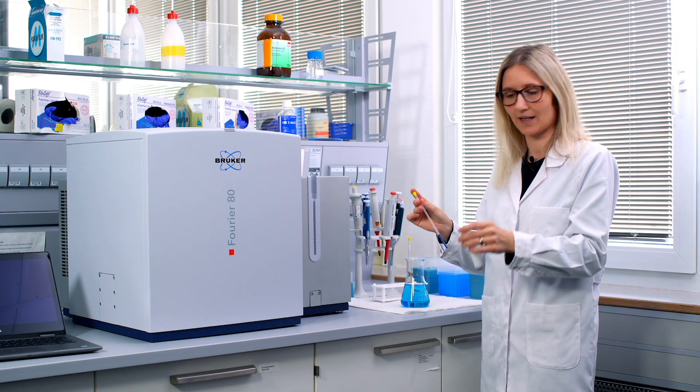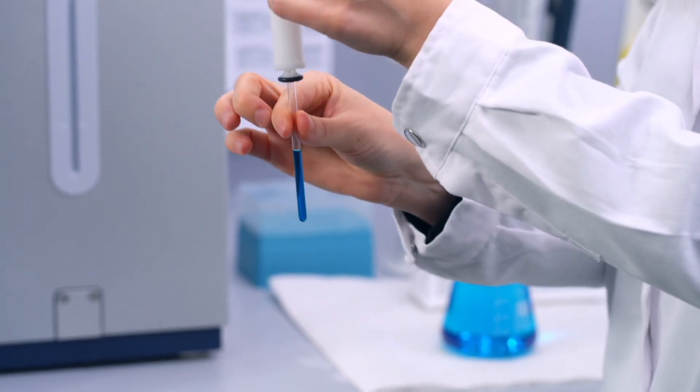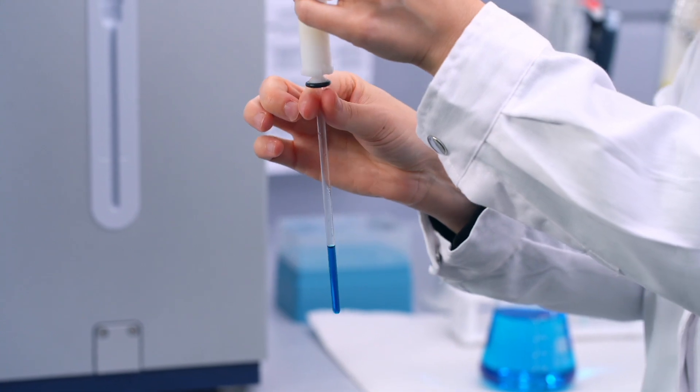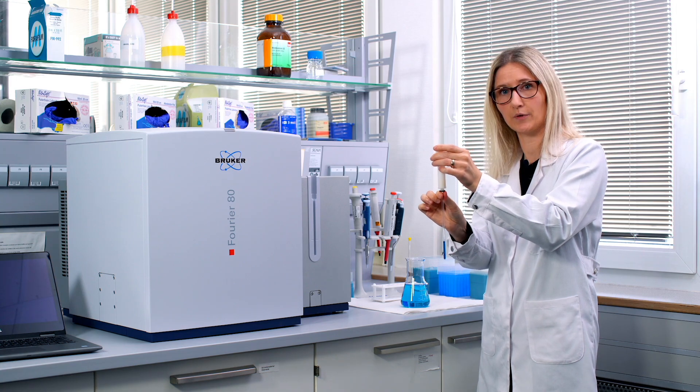You just take the sample, insert it from the top into the sample holder. Pull it through. Be careful but pull it through until nearly the end. That's important. Take your time with doing that.